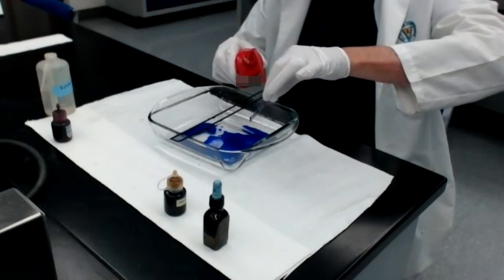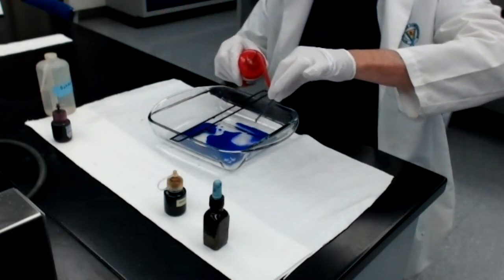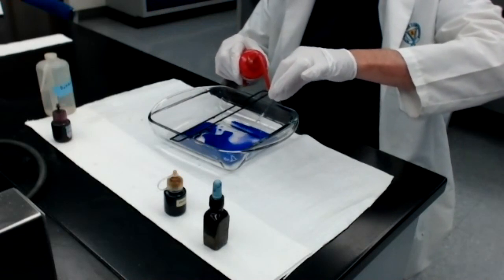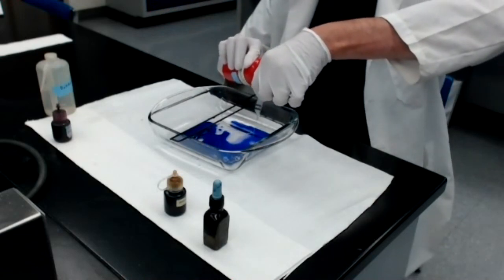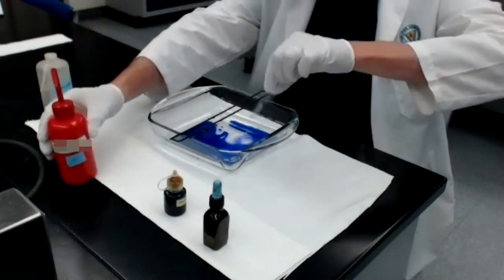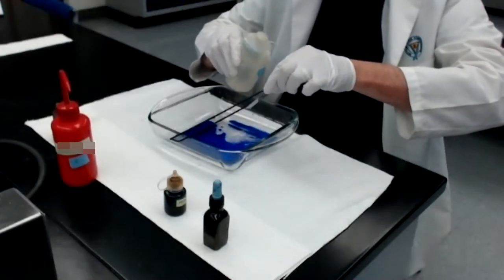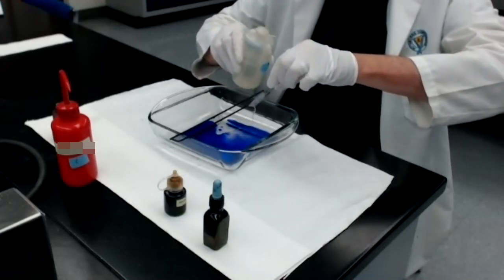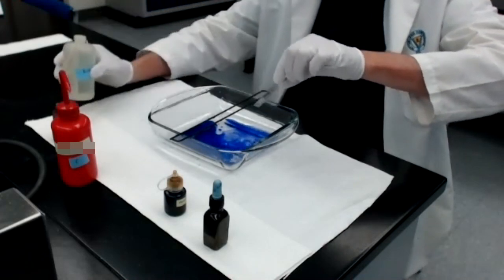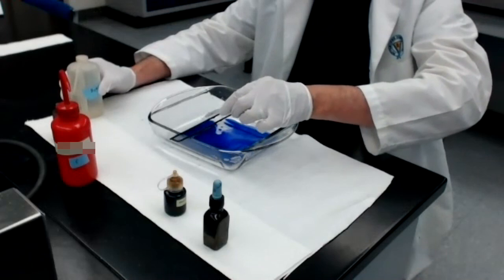And now I squirt fresh acetone above the smear and allow the acetone to run across the smear, dripping into the dish. Once there's no more purple coming off, and there isn't, I stop that. I also wash the back. And then after I shake off that acetone, I come back with water immediately and I wash the acetone off. You've got to get that acetone off there with the water because otherwise it'll continue to decolorize and you'll get erroneous results. Shake the water off.